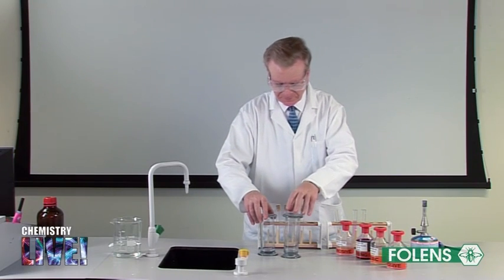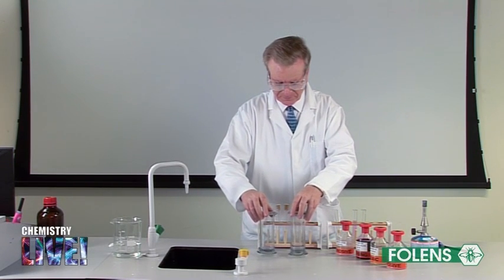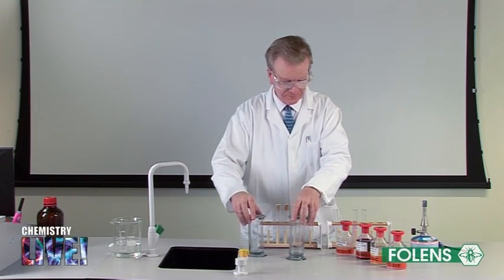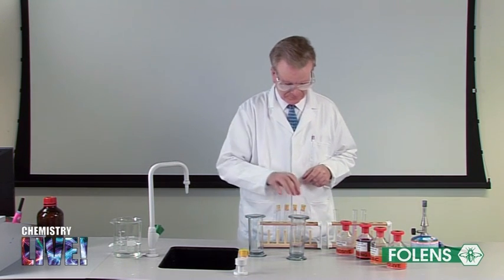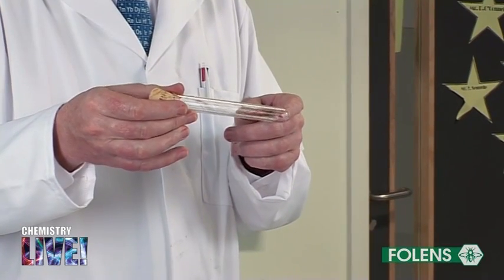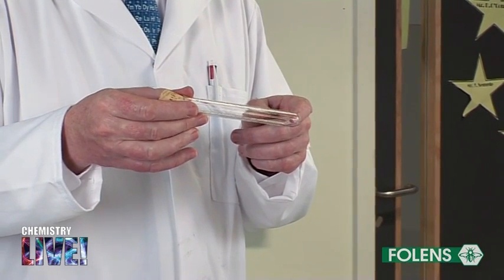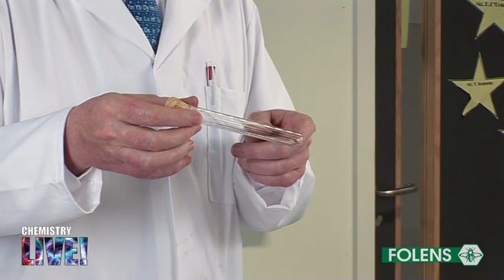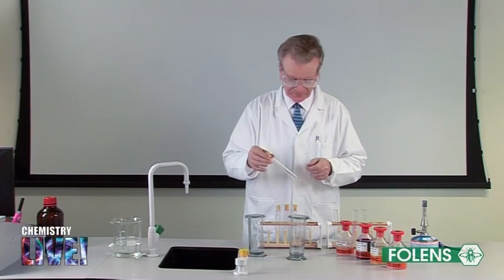In the next part of this experiment, we will examine the properties of ethene. Note the physical properties of ethene. It is a colorless gas with a sweetish smell. The fact that the gas can be collected over water shows clearly that it is insoluble in water. Otherwise, the gas would simply dissolve in the water instead of bubbling through it.